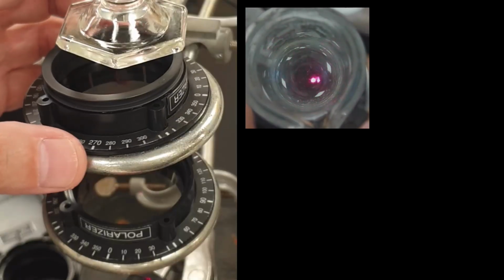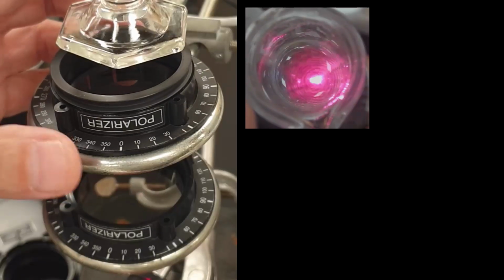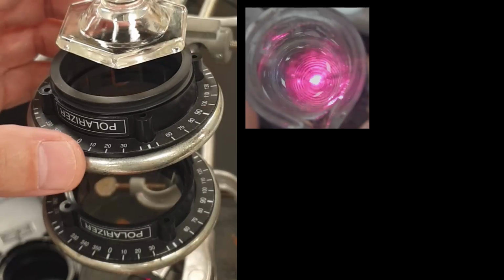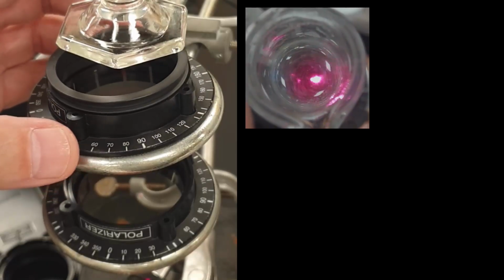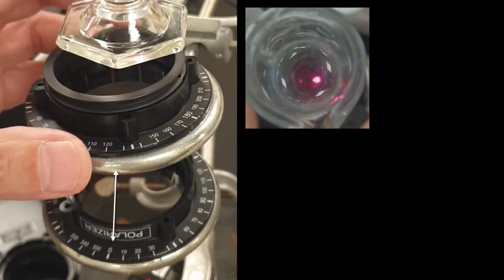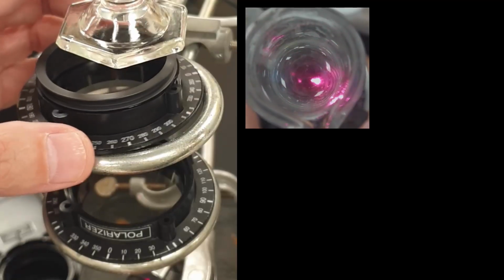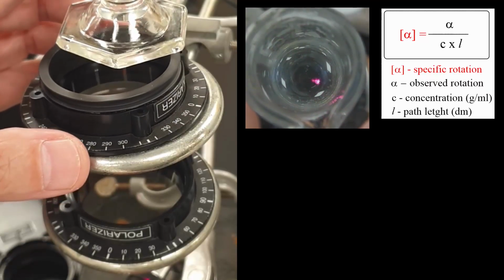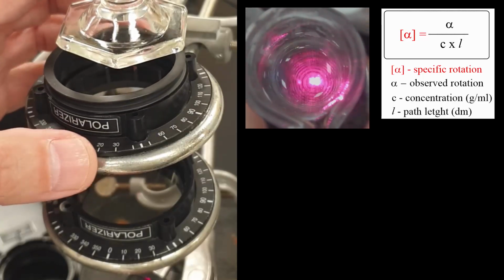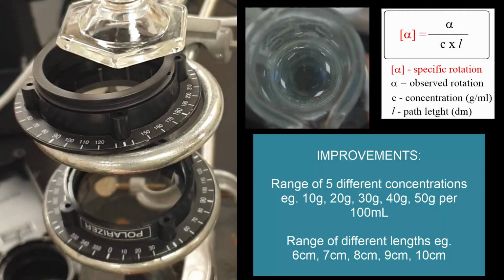And so the issue is I'm not quite sure if that's a 10 degree rotation, or whether it's 110 or 190. I'm not sure how many times it's rotating. So I think a solution to that would be make it in different solutions, dilute it out, and maybe use the formula and go up in 10% concentration differences or something, and then I can see a gradual change in the rotation of the light.